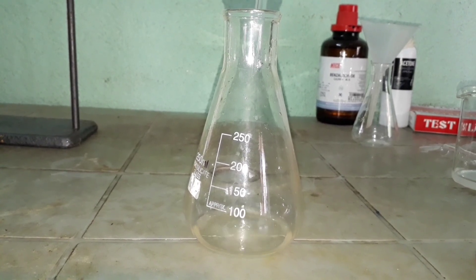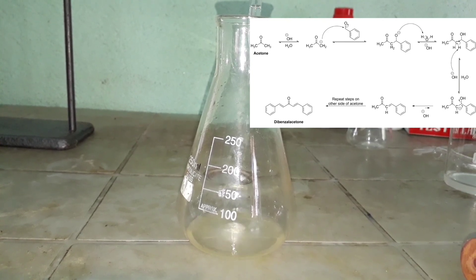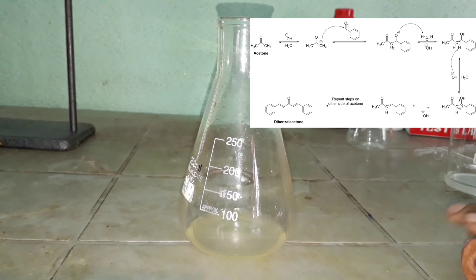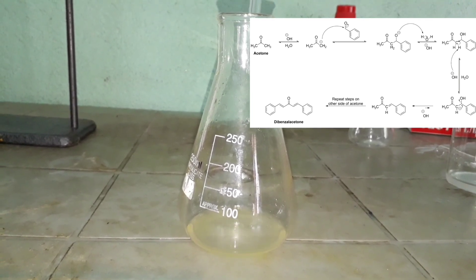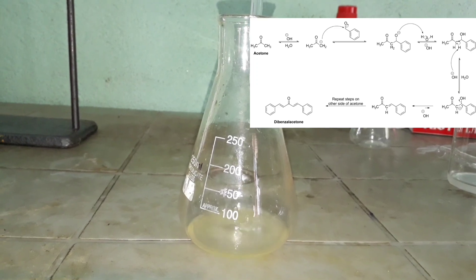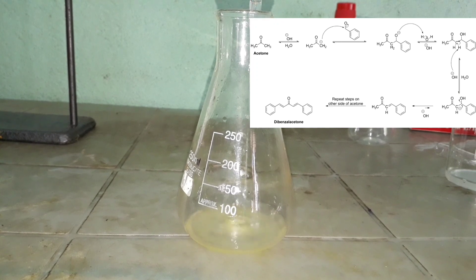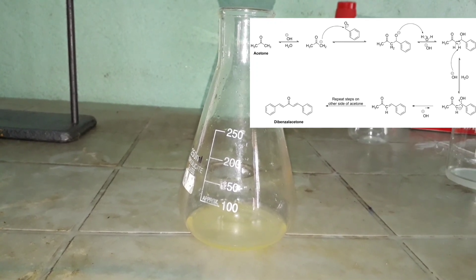In the first step, one of the acidic alpha hydrogens of acetone reacts with the OH⁻ from NaOH. This leads to the formation of a negative charge on carbon, which can attack the carbonyl of benzaldehyde. The negative charge that forms on oxygen then pulls a hydrogen from water, and OH⁻ is regenerated.